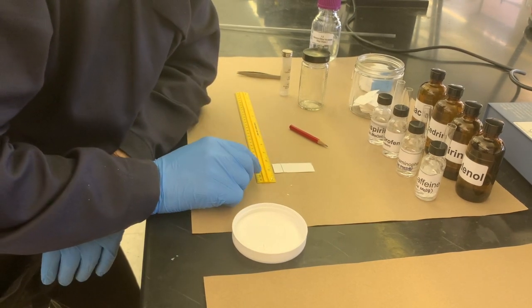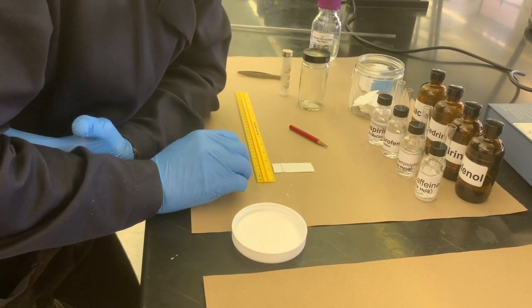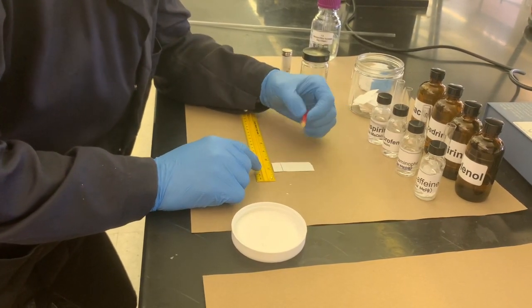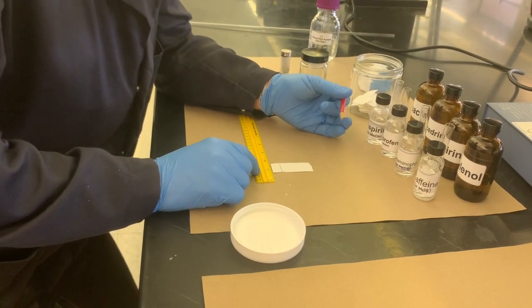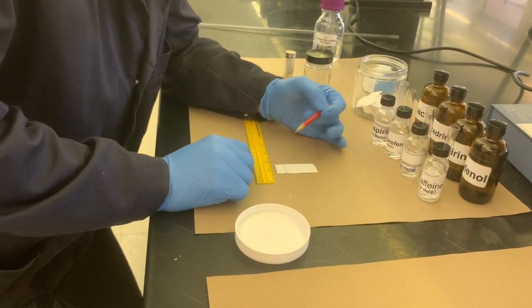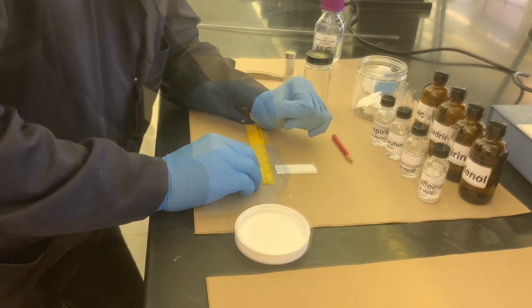The important thing for using any kind of TLC plate is that anything that's soluble in an organic compound is going to move up the plate. The graphite inside of this pencil is non-polar, but it's not going to move from its original point. So that's why you always want to use any kind of graphite-based pencil, because it's good for making marks without worrying that they're going to move. Inks are definitely going to be dissolved, and so you don't want to ever use a pen for this.